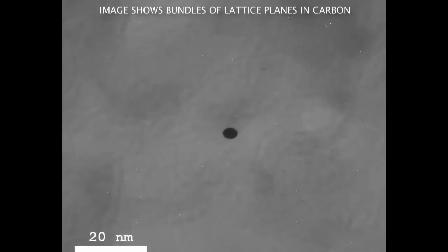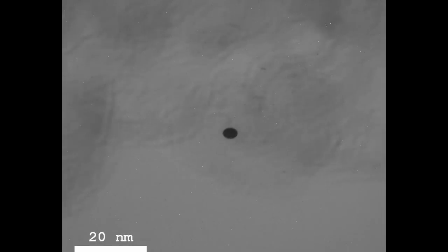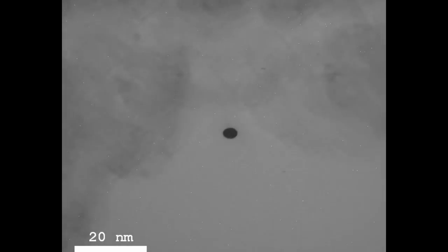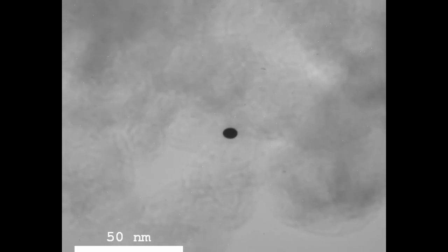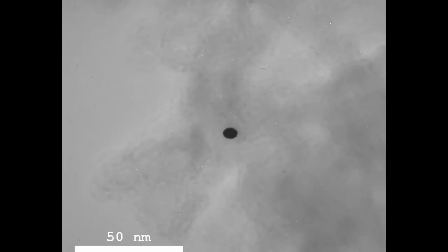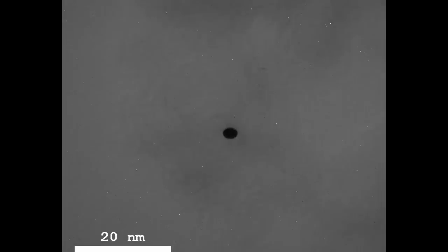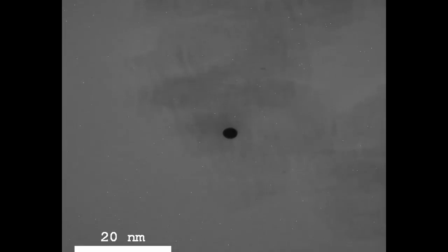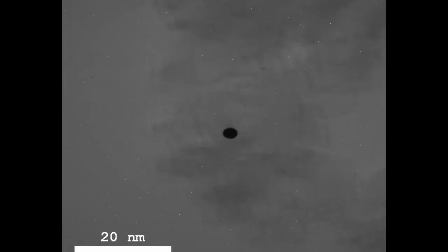Here I put in another sample — carbon black particles that look like macaroni-shaped structures. I want to demonstrate phase contrast again: as I change the focusing, you can see that the phase contrast effect creates a contour around each object that is either black or white depending on which direction I turn the focusing knob. In high resolution imaging, when imaging lattice planes, you want these contours to overlap periodically in relation to the lattice to produce a high resolution image. In a modern TEM you can actually see individual atoms with these techniques.